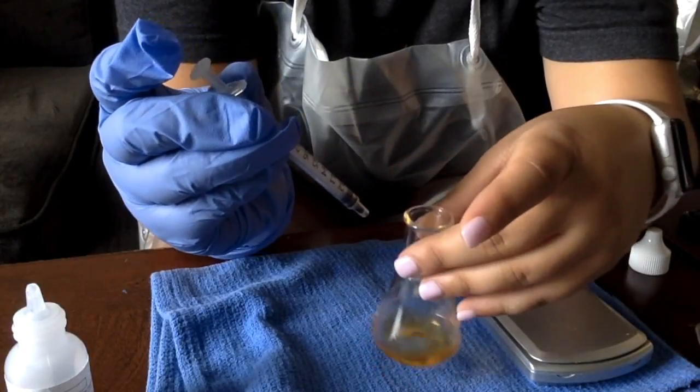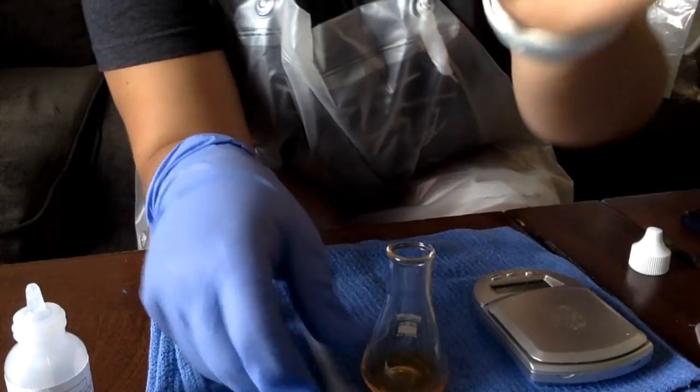Color change. So there was not an immediate response, but after a little bit, it took not too much, but there was a change in the volume. So I'll record my data, and I'll do this trial 2 more times, and then I'll do all my calculations after.